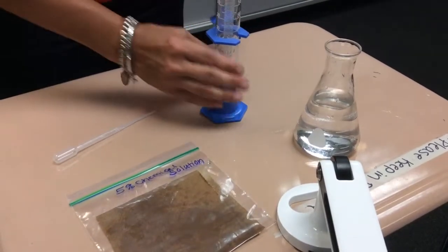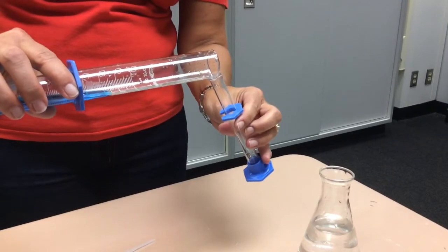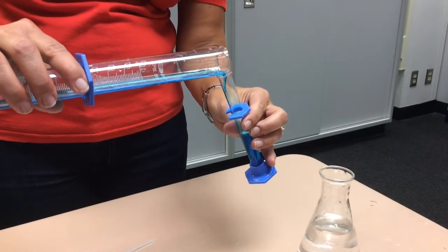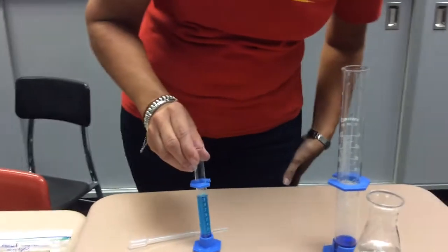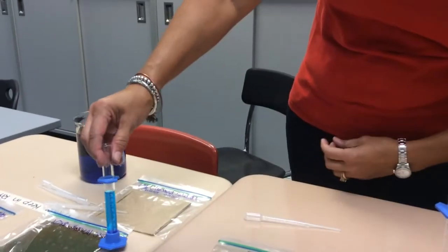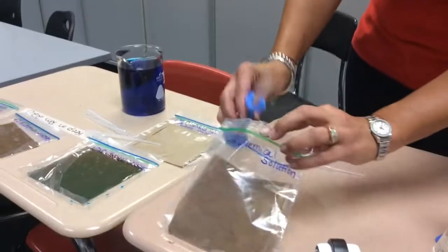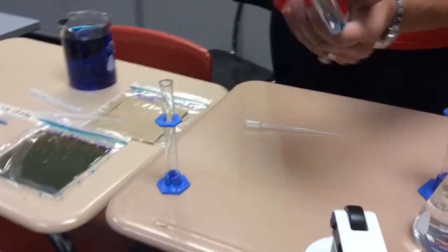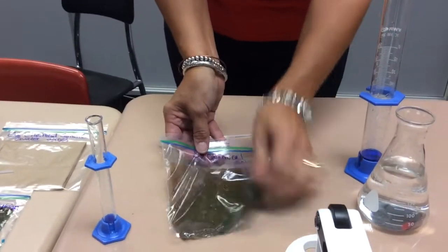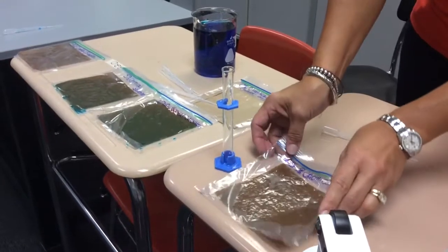So I'm going to take this solution, my now 5% solution, and measure out 10 mils of that. If you compare the color of that one to the original, you can see it's a little bit lighter, and that's because it's diluted halfway down. It was 10% originally, and now it's 5% of the chemical. Okay, so I get my paper towel wet, and now that bag's ready to go for my radish seeds.